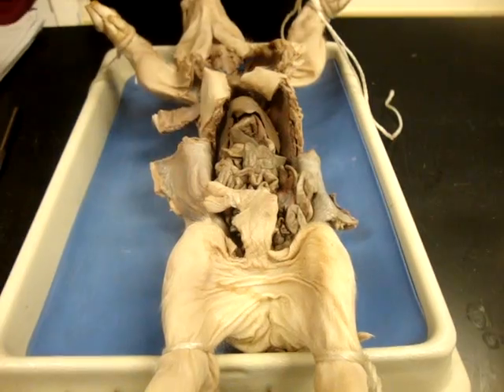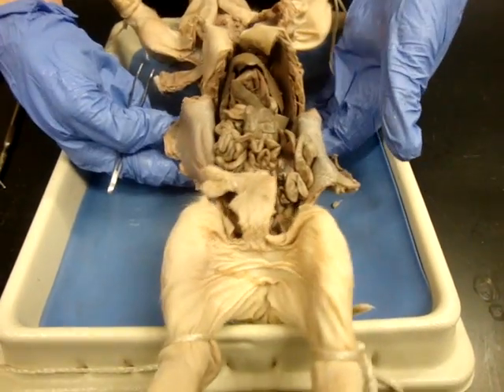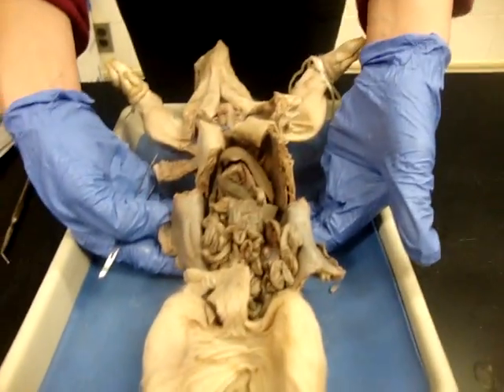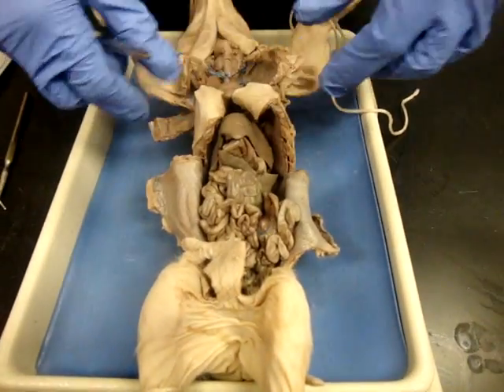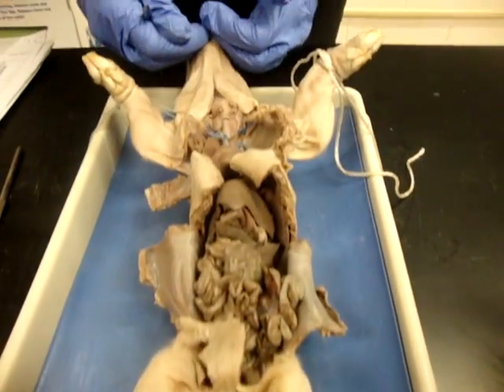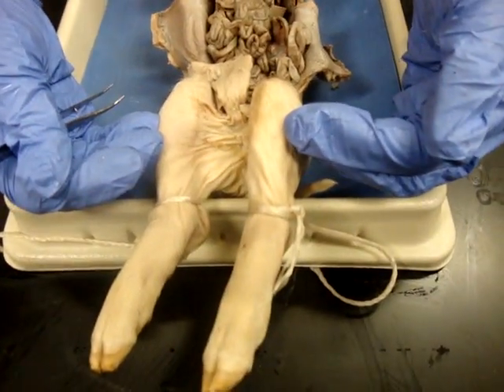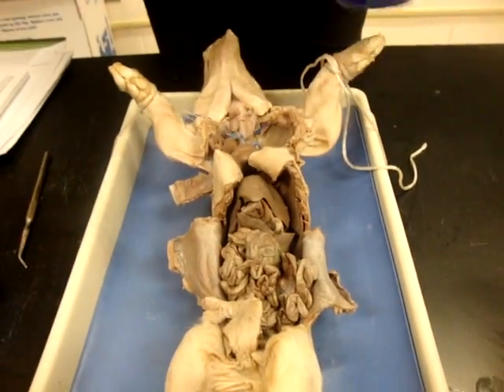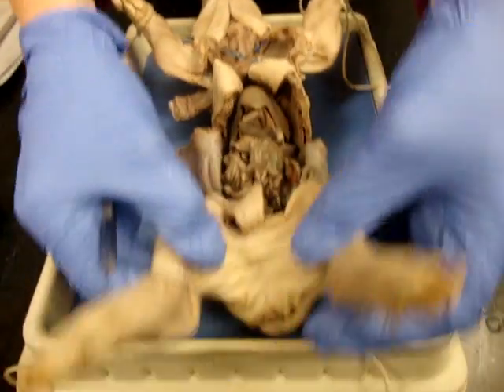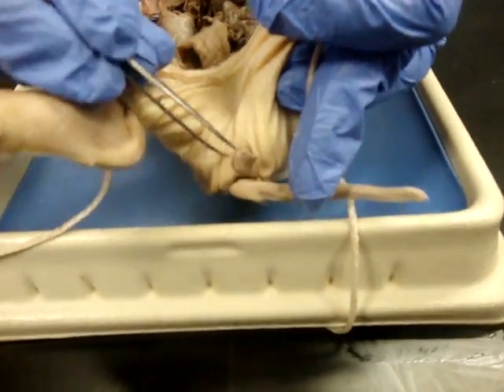Make sure you're comfortable with the different directional terms. Dorsal is the back region, so the pig is resting on its dorsal side with its ventral side facing us. Anterior is towards the head region of the pig. Posterior is back towards the back of the pig. Make sure you can determine the sex of the pig just by looking at external structures — your urogenital papilla tells you that it's female.